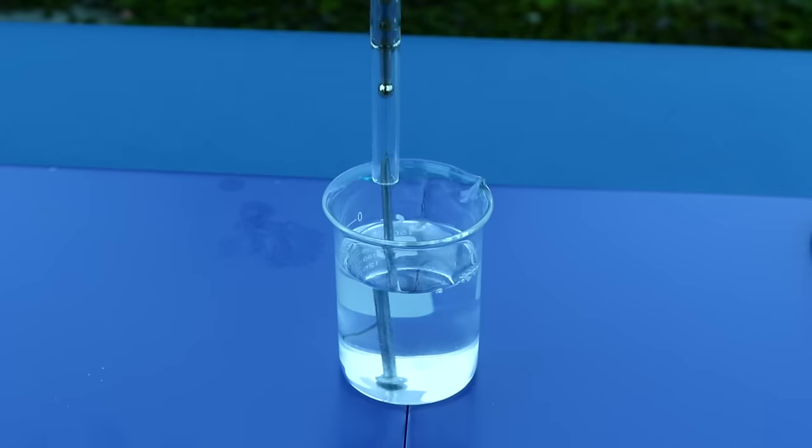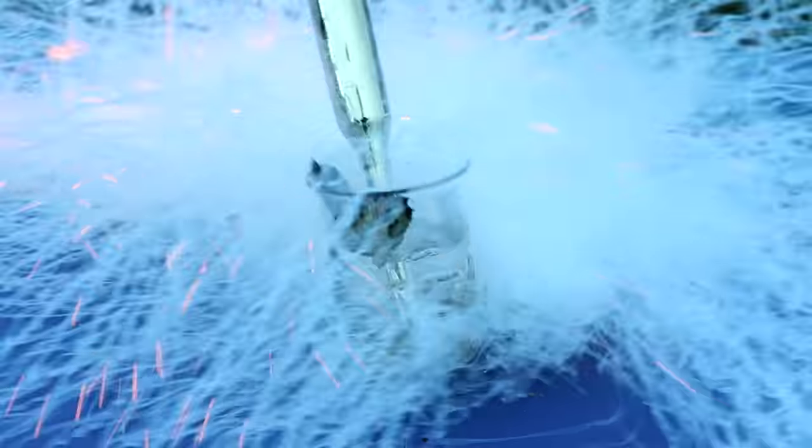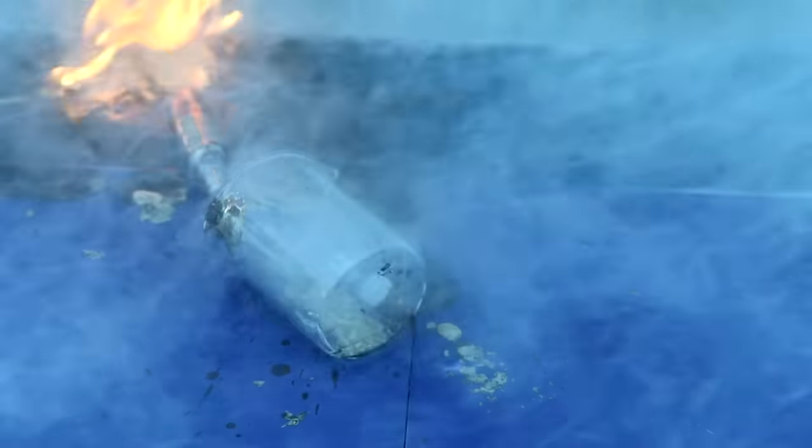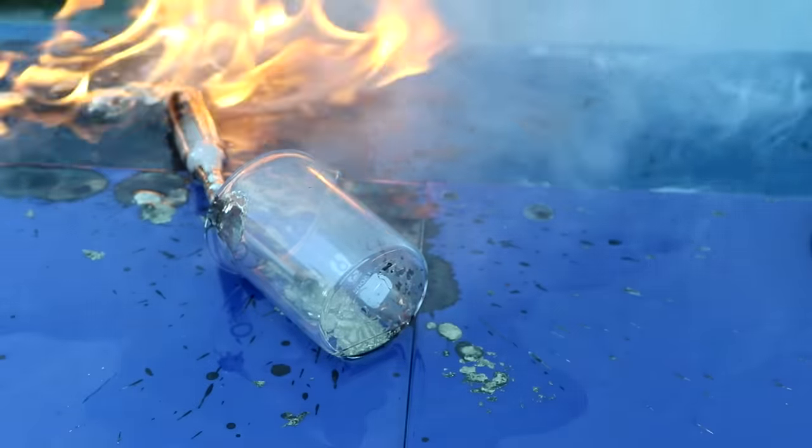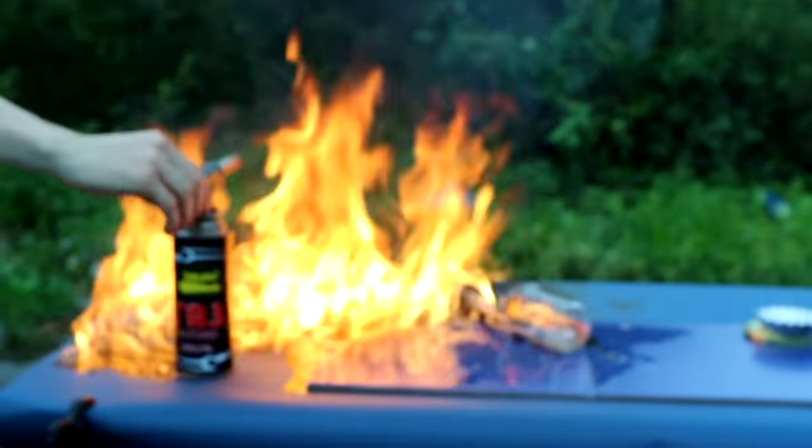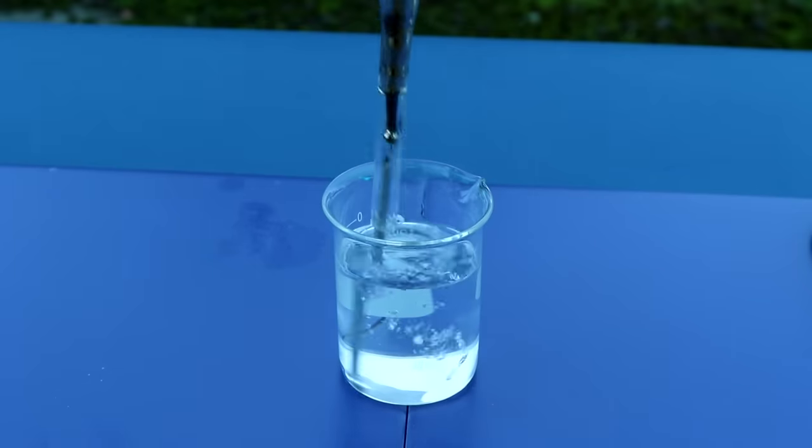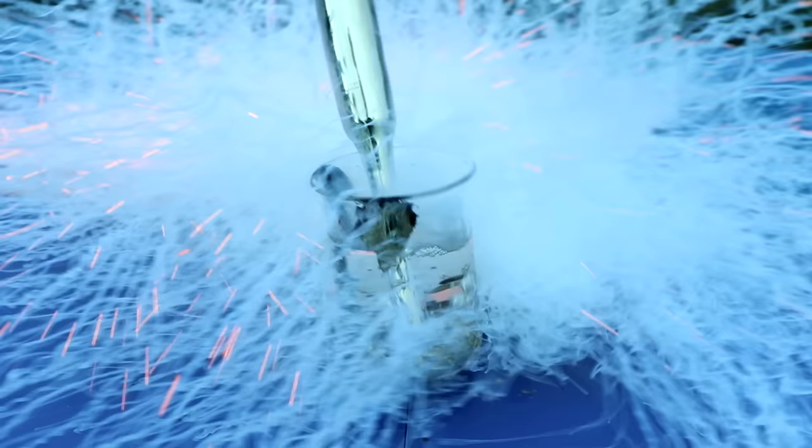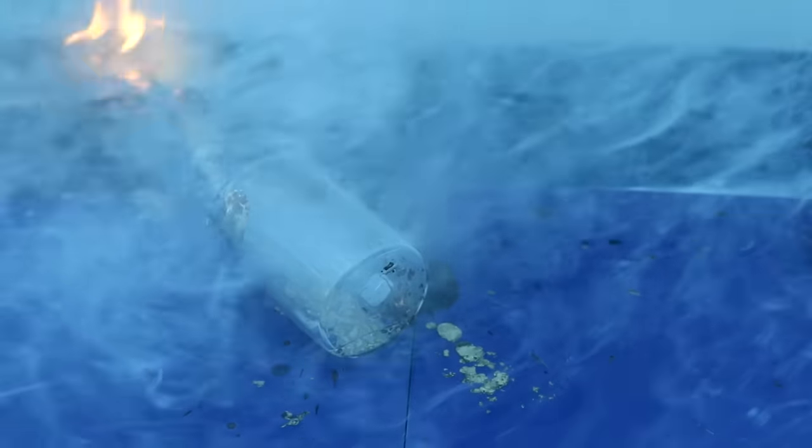However, something went wrong during that part. The liquid cesium instantly ignited in air, burning everything around it. That happened most likely due to the fact that the cesium in the vial was liquid. A water hammer happened, and the top of the vial broke off, pouring cesium onto the table.